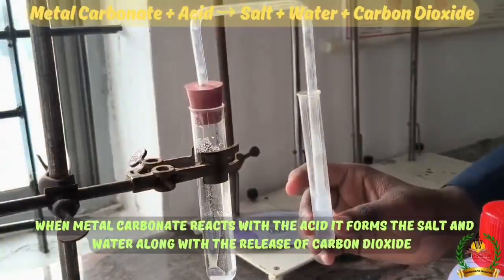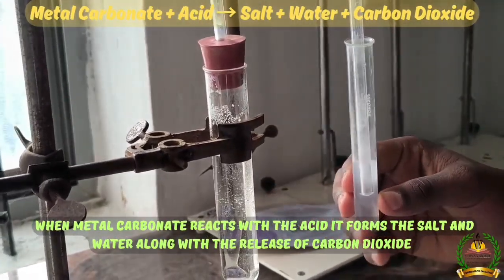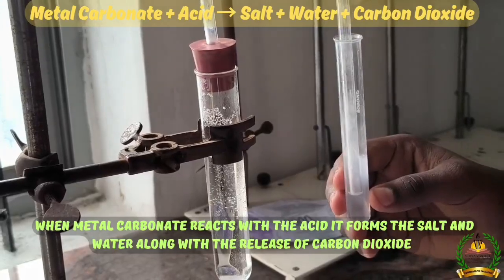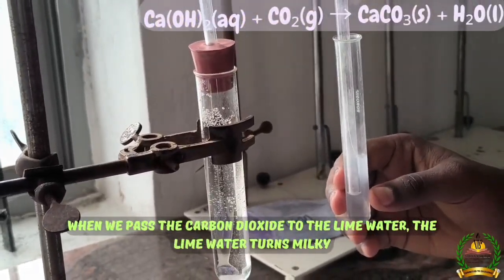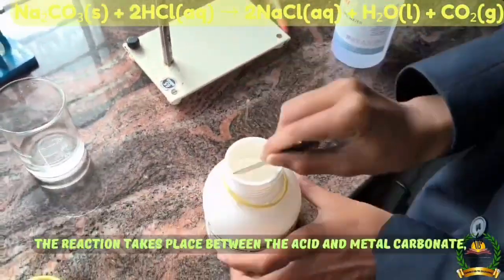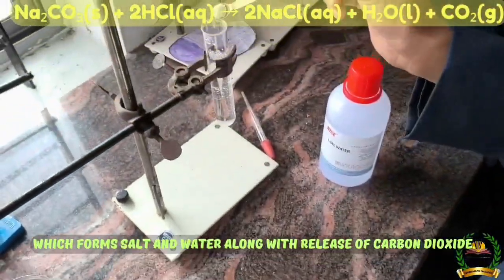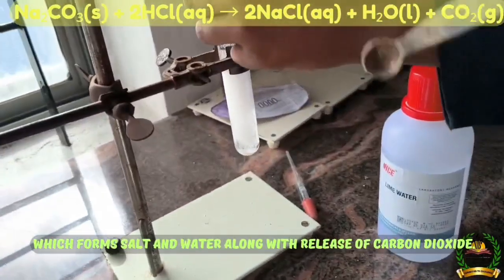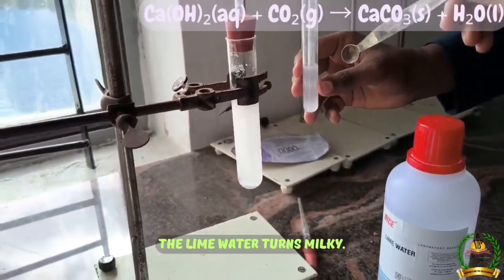When metal carbonate reacts with the acid, it forms salt and water with the release of carbon dioxide. When we pass the carbon dioxide through lime water, it turns milky. When we add sodium carbonate to dilute hydrochloric acid, the reaction takes place between the acid and metal carbonate, which forms salt and water along with the release of carbon dioxide. When carbon dioxide is passed through lime water, the lime water turns milky.